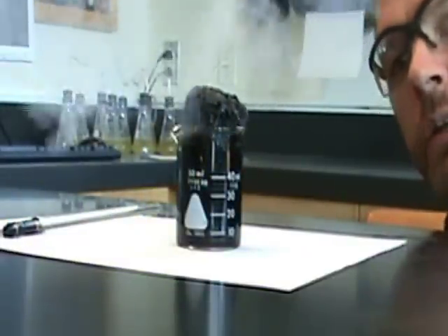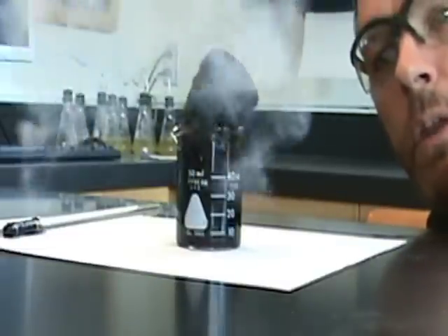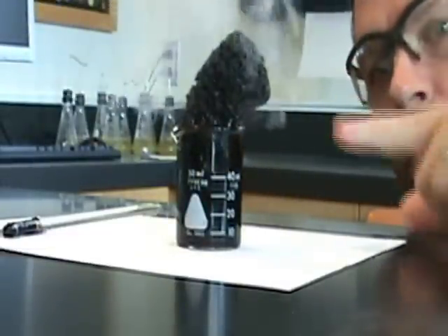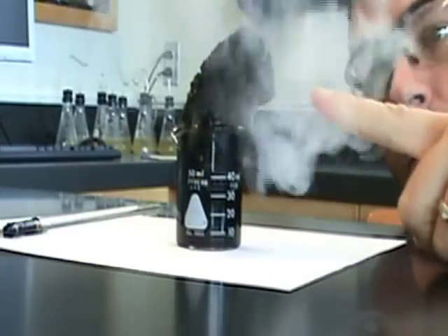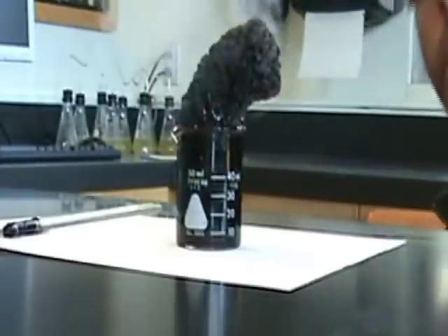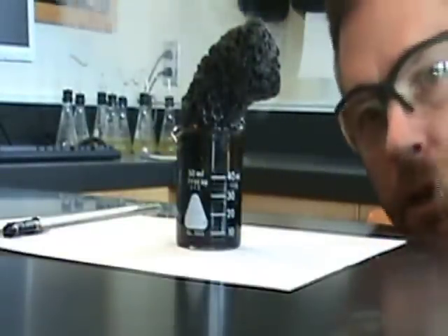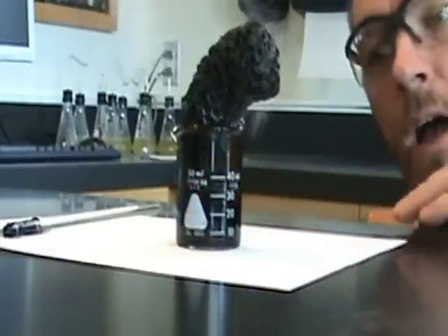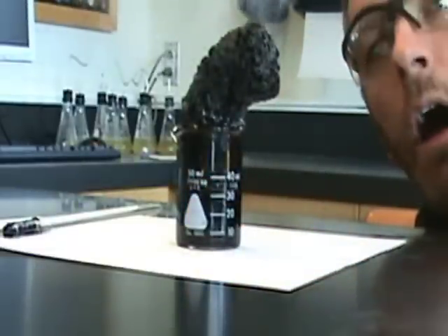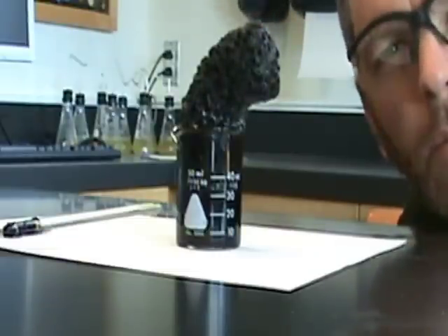You can see some steam coming off — that is your water, and it's actually disappearing from the compound and leaving behind this black material. Part of science is observing, and you can see all sorts of things. I'm observing the steam. The steam implies that there's heat, and there actually is — if I touch it, it's actually pretty hot. And then we have the carbon, and you can smell it — it smells a little bit like caramel or burnt marshmallows here.